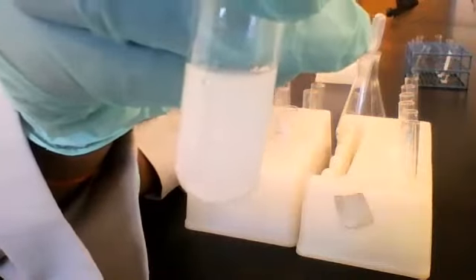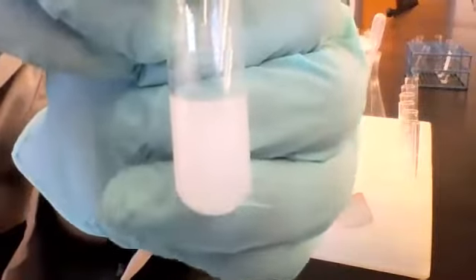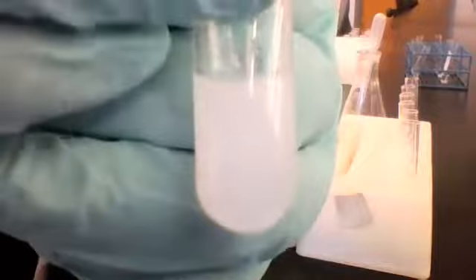And what color would you say this is? A milky white color. Yes, I'm seeing a very pale white as well. So milky or cloudy or pale white, whichever word feels right to you.